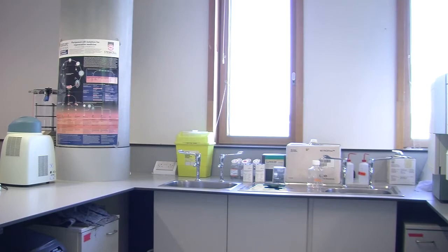Okay? And that works. You get really good mixing, and then you just get the bubbles away. It will, because it's frothy, because there's something in it, which is a detergent. There's about 9% detergent. So effectively, it's soap and water, so great. So that's good, excellent. Try using all of the fingers though. And yeah, it's one of those things you can do.